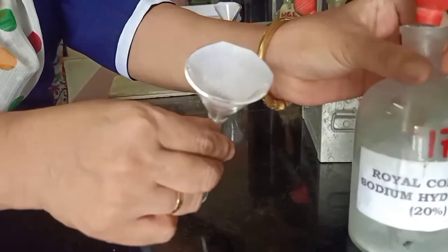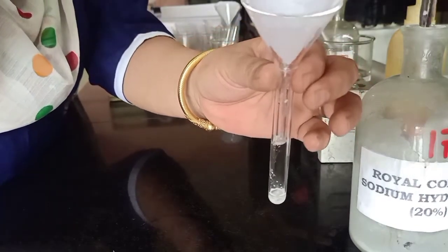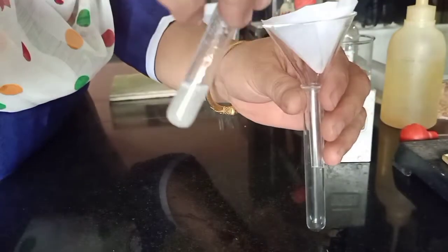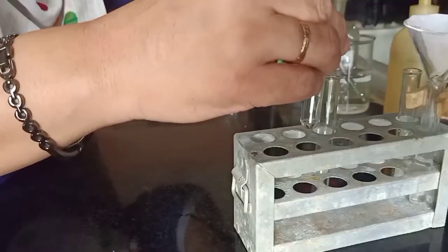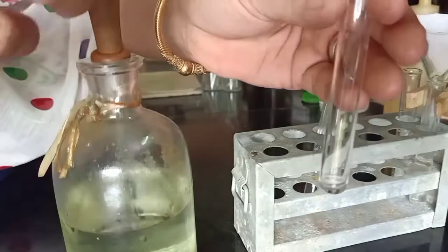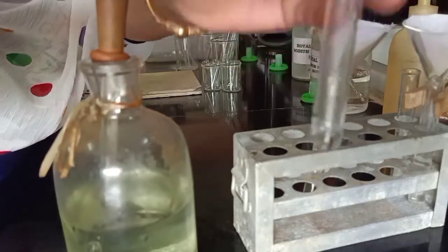The solubilizing reagent is sodium hydroxide, so we will add sodium hydroxide to this residue. As you can see the residue is coming down. Then we will check for solubility and re-precipitation. We will now filter this and check for re-precipitation using concentrated HCl. As you can see, I am not getting any re-precipitation.